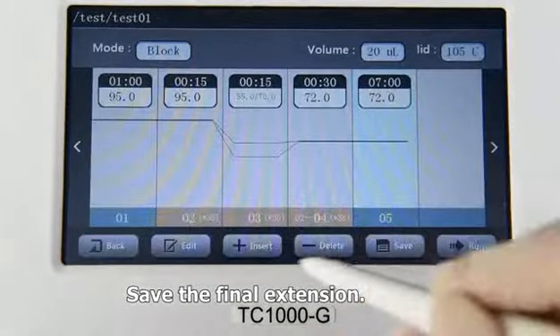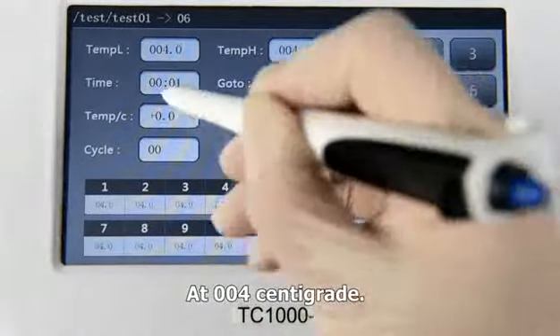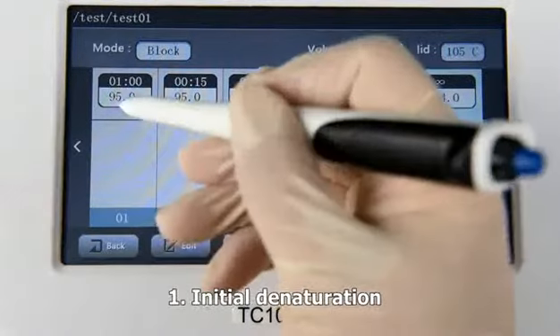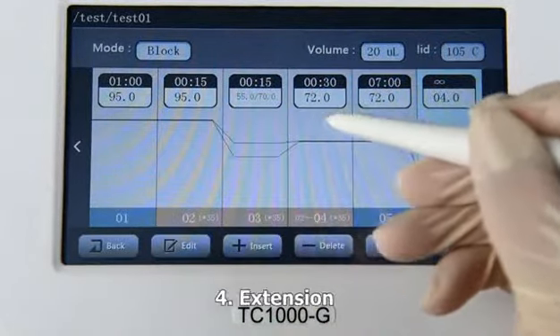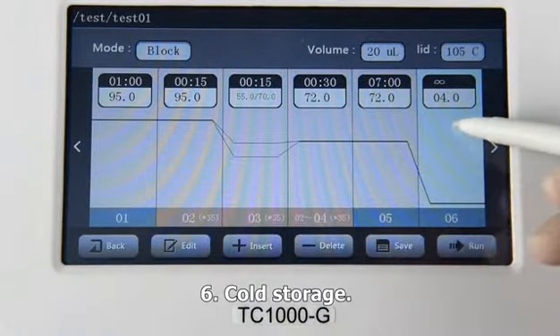Save the final extension. Set the onboard cold storage at 4 centigrade for unlimited time. Review the program. Initial denaturation, annealing, extension, repeat 35 cycles, final extension, cold storage.